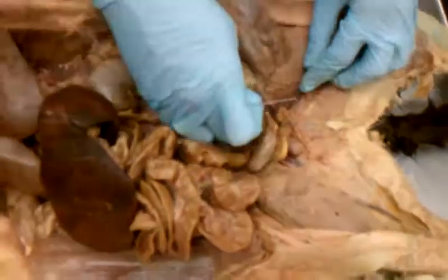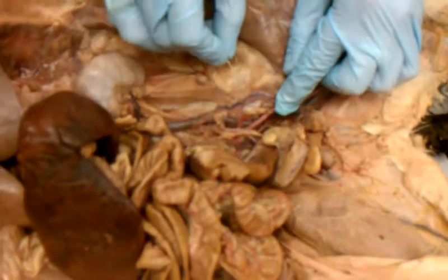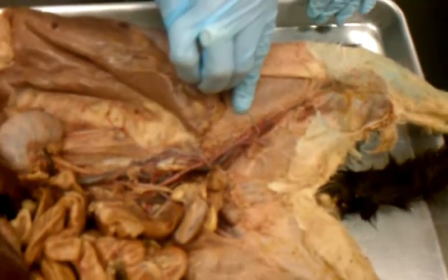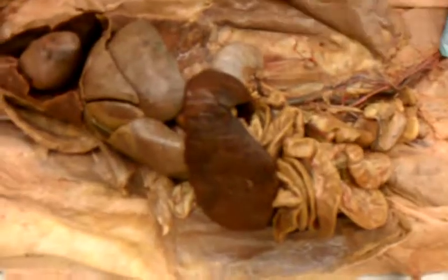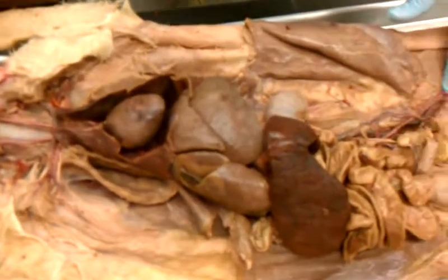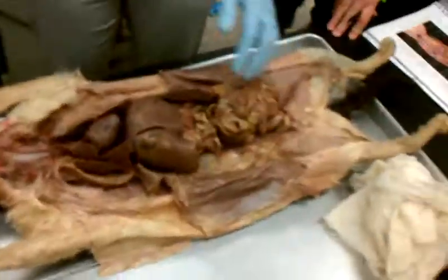So this is the external iliac artery right here. So if you find this split right there, that would be the external iliac. And then down here would be the femoral. It's over the femur. So that's the femoral artery. So next, if someone would semi-clean, switch my papers out. Okay. So now you have your veins. And your veins, same thing.